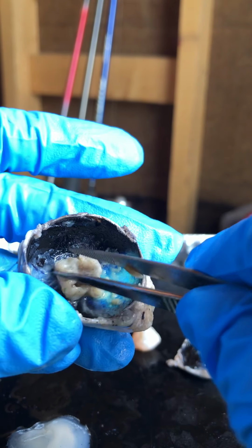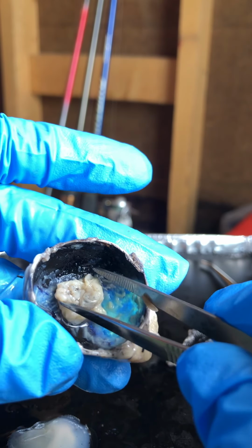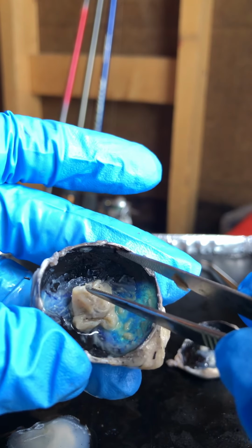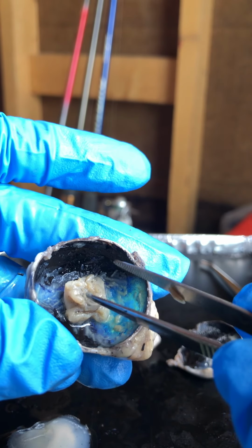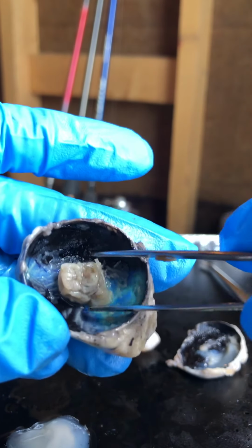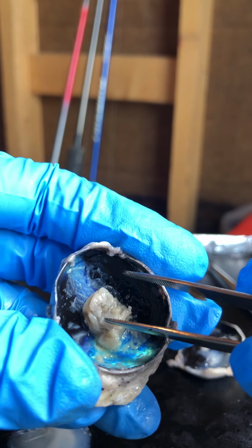It has photoreceptors which detect the incoming light. The substance that makes it pressed against the inside of the eye is the vitreous humor, which is the reason why the retina is pressed against the inside of the eye. So it comes off easily in one piece like this. And it appears that the retina is passing through the hole in the eye.